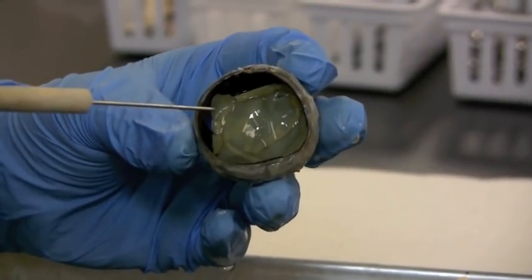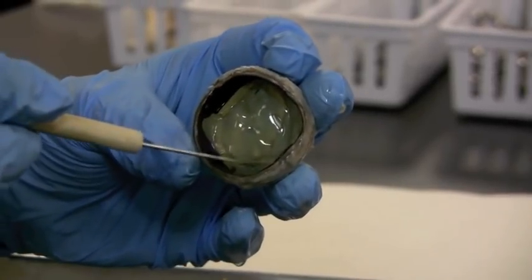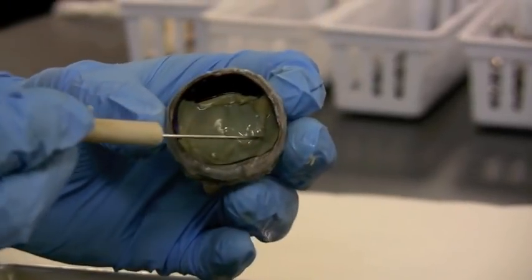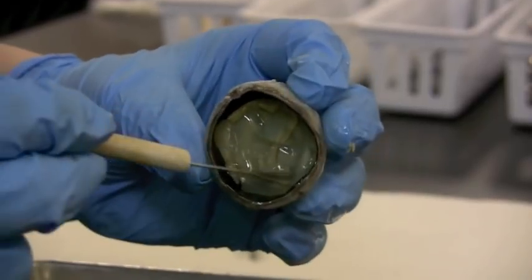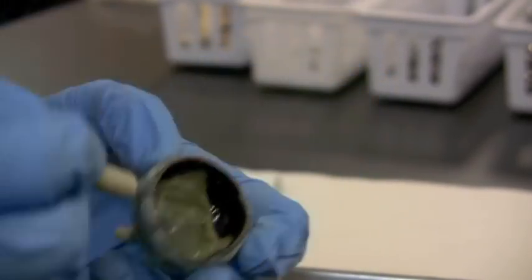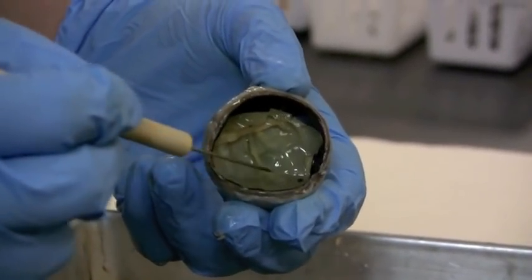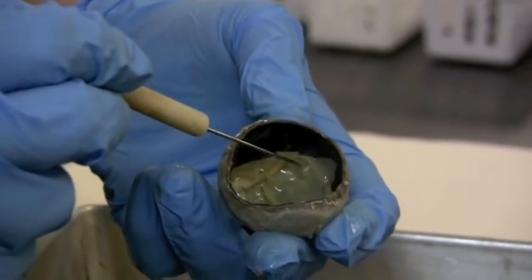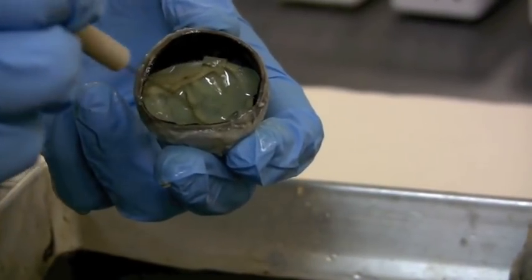So I had to gather back my retina, which kind of falls apart pretty easily. The jelly stuff that's coming out, that's all the vitreous humor in the posterior chamber, and all of this tan membrane that's coating the back, this is the retina. This whole bit is the retina itself. Not the gel, but the membrane. It's a very thin coating that surrounds the whole area. Remember, there are three layers.